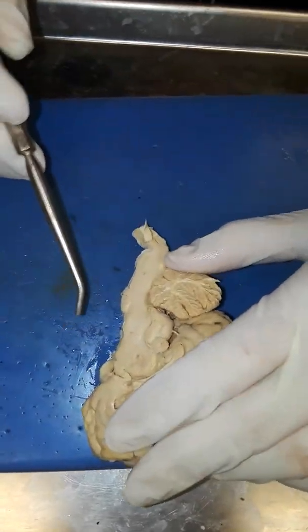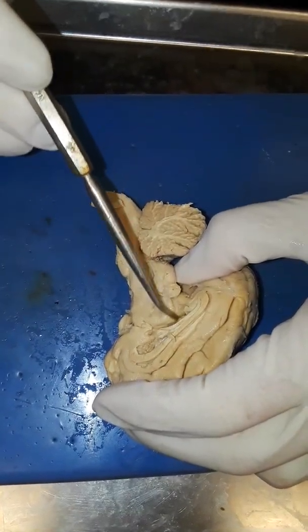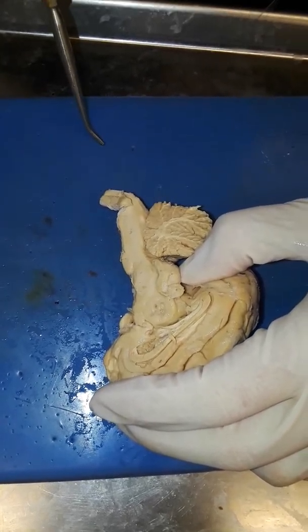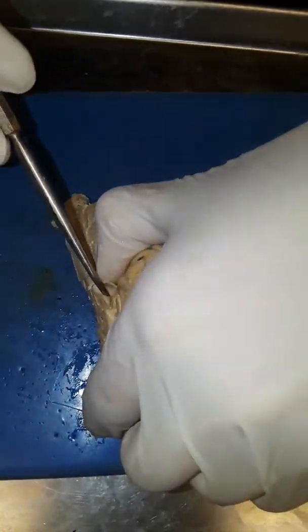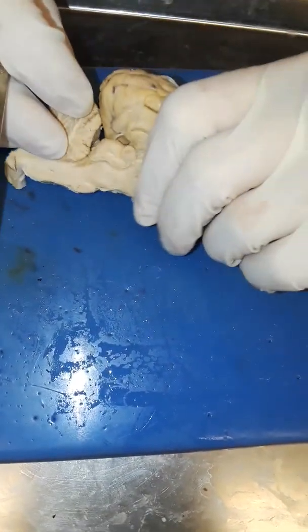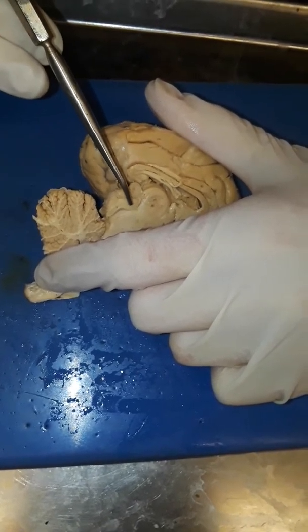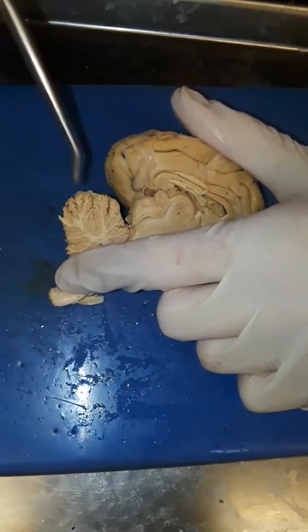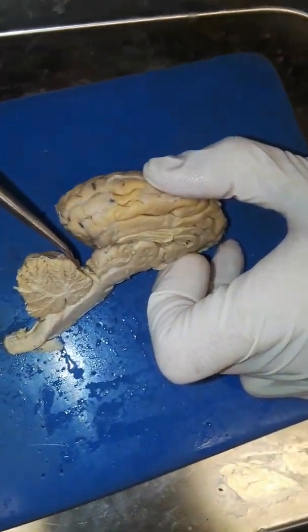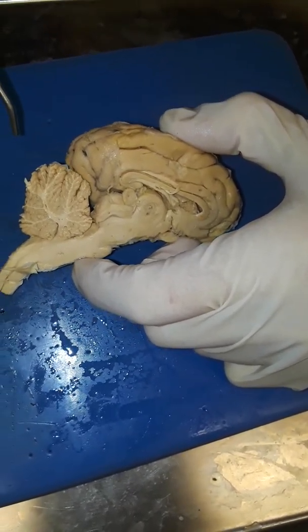On the brain stem, we're moving on to the thalamus — the thalamus is the region in front of the pineal gland right here. Then we have the pineal gland, that little structure there. The corpora quadrigemina again right here, and the anterior colliculus and posterior colliculus — you'll need to be able to identify those from the top portion, with the cerebellum and cerebrum off of that. That's the brain.